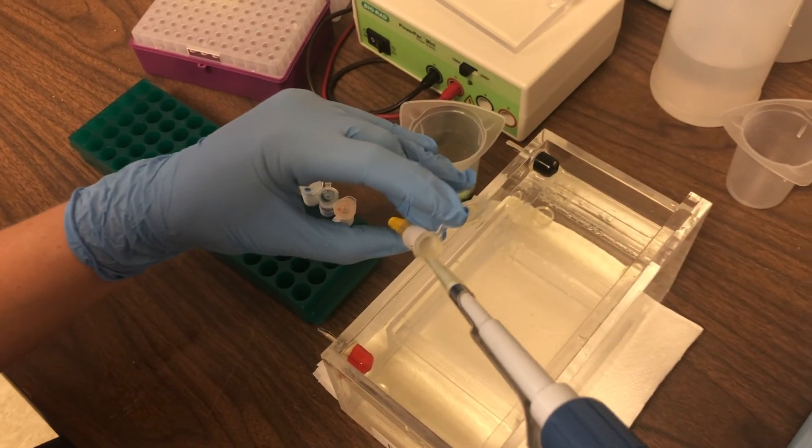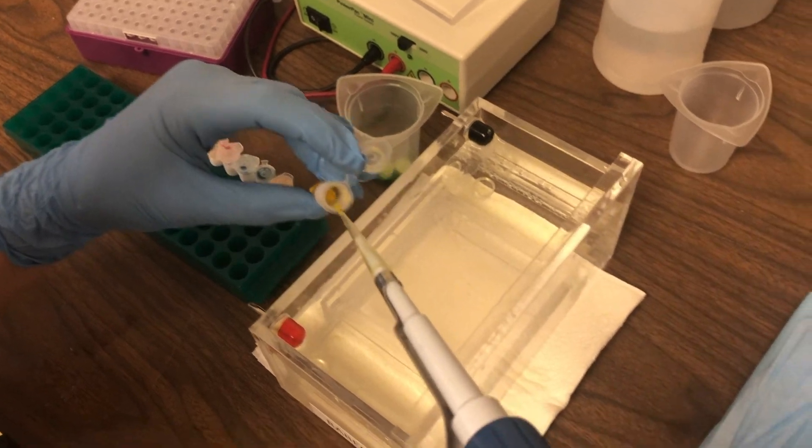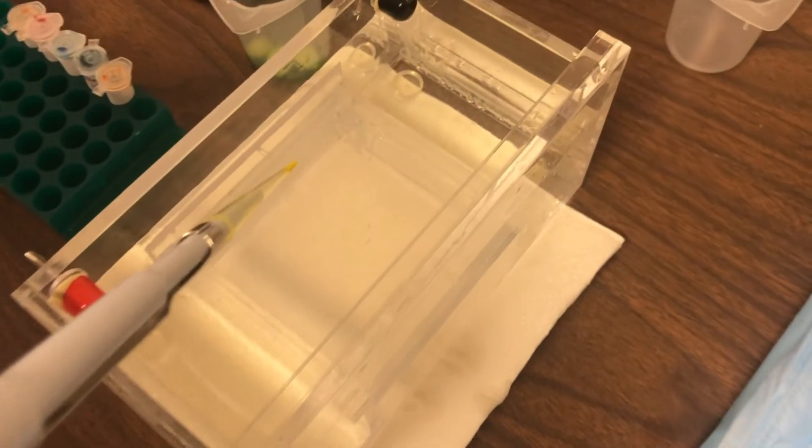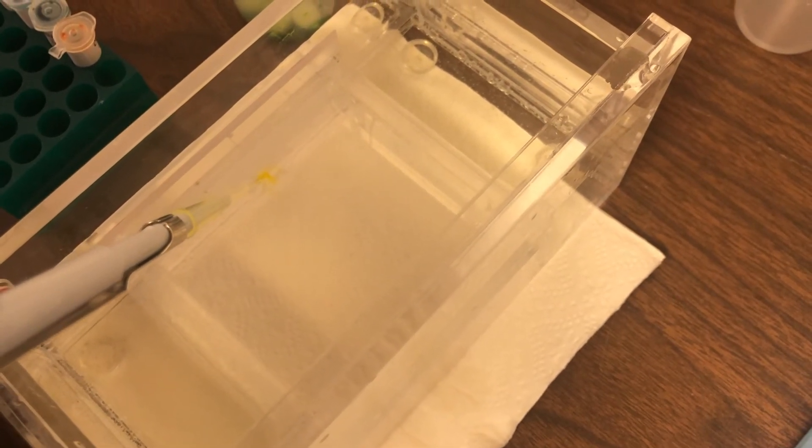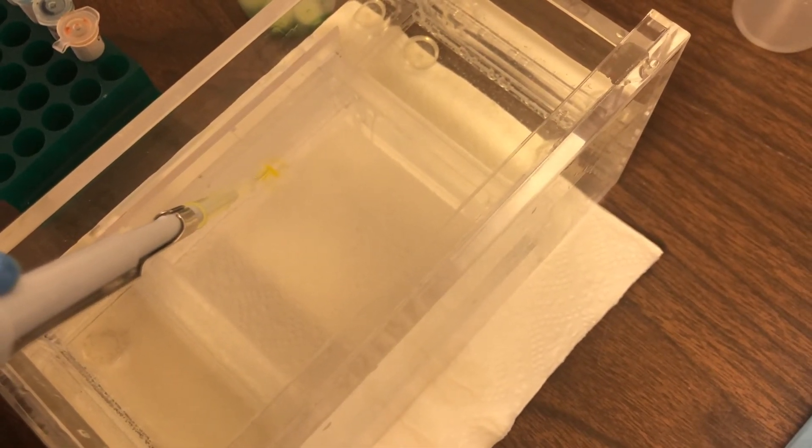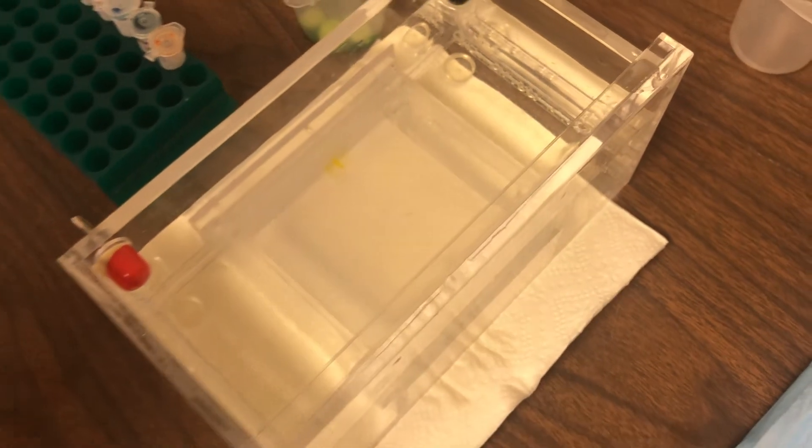Let's get ready to load our first sample, yellow number 5, into lane 1. Now, loading agarose gels takes a little bit of practice, and it's actually really a lot of fun. So after we load our first sample, we always switch our tip.